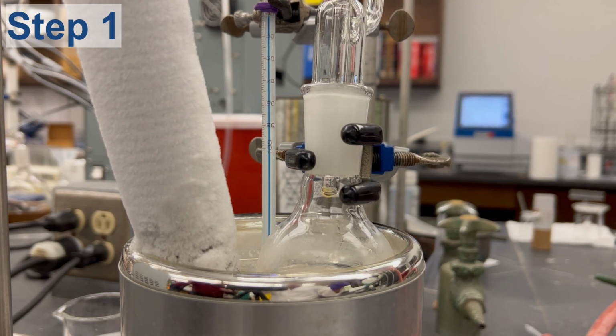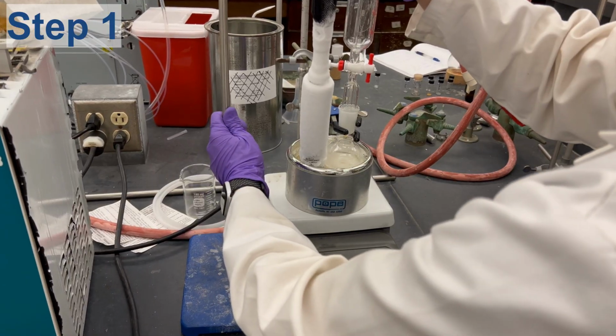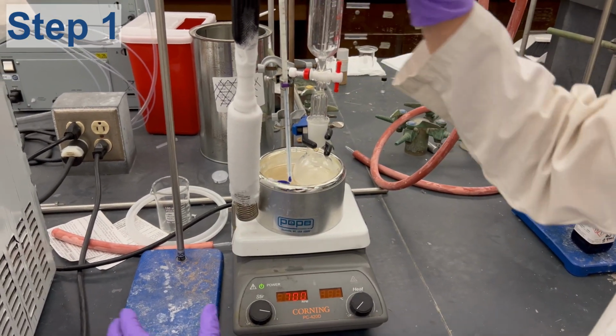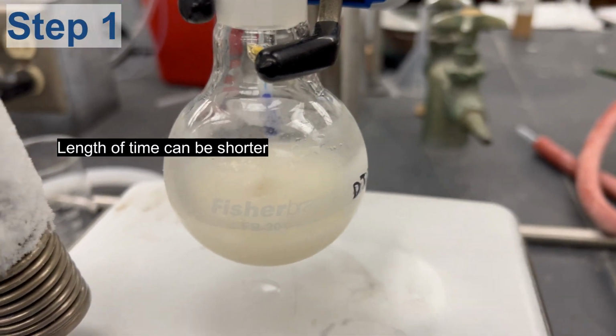Once all the Grignard reagent has been added, make sure to turn off the chilling instrument and gently remove the coil from the chilling solution. Leave the reaction stirring at room temperature overnight.